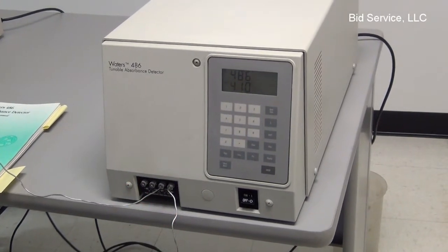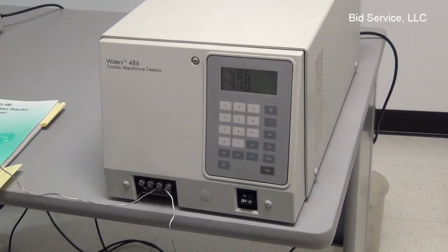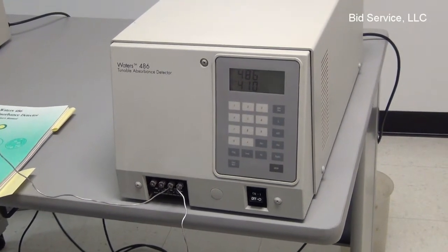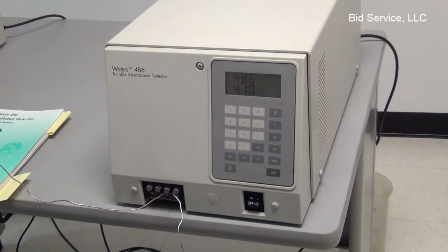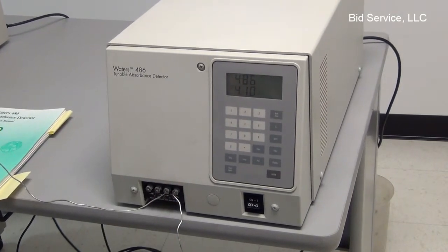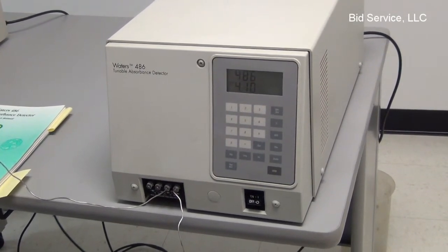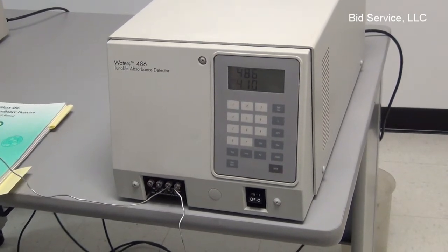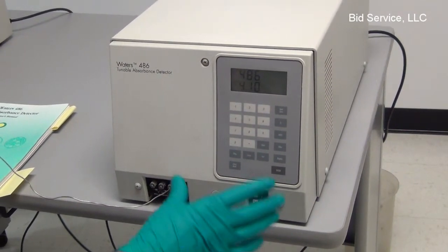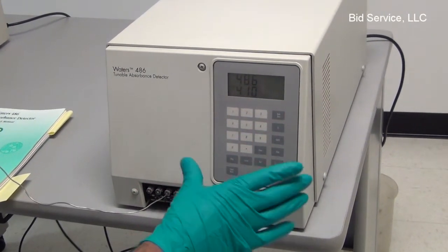On power-up, the unit indicates that the lamp is on. The system also runs diagnostics on power-up and any error messages will be indicated. The unit is operated from the keyboard on the front.